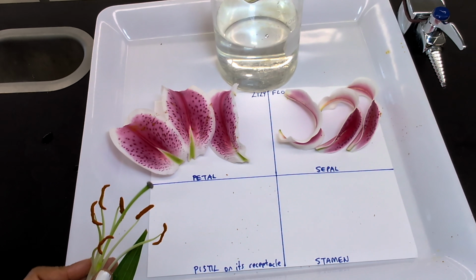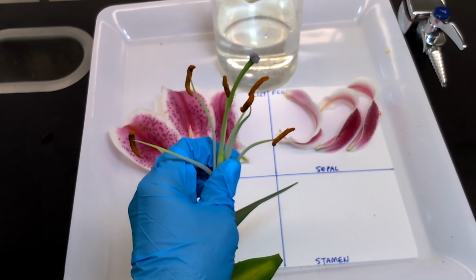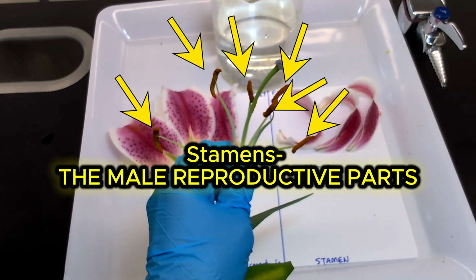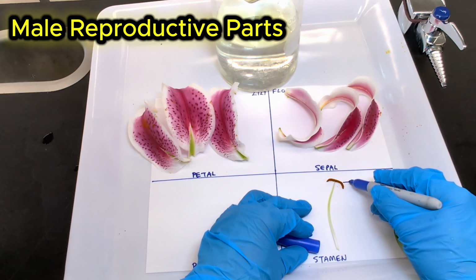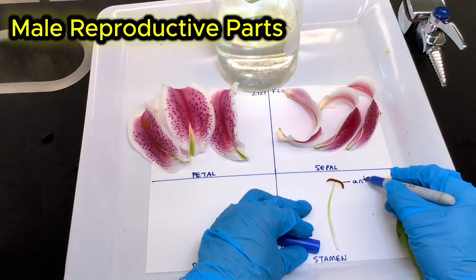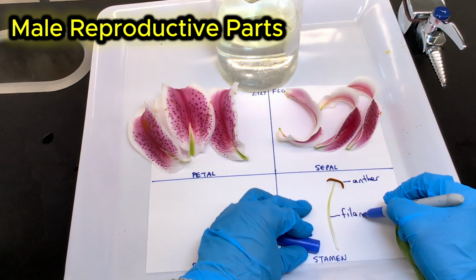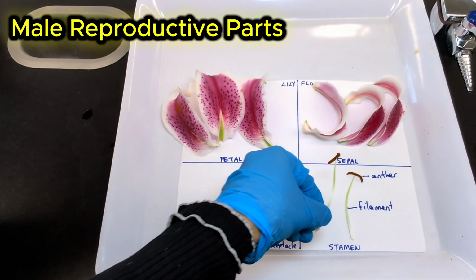But before we look at the stamens, let's get our gloves. You'll see several long, slender structures with dusty tips. These are the stamens, the male reproductive parts of the flower. Each stamen consists of an anther at the top, which produces pollen, and the filament or the stalk. If you touch the anther, you'll notice the yellow or orange powder.